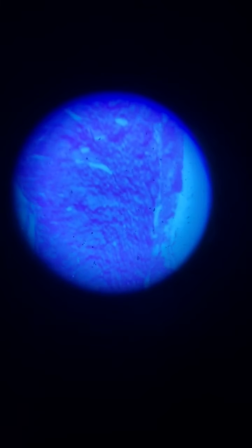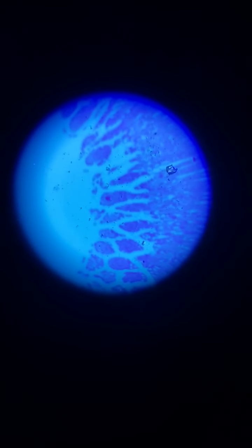It's the thin cross cut of the small intestine. You see how it looks like they have these deep valleys at the end, like in the middle. As we move this around, you're going to see there's like a big space in the middle, and that's your small intestines. That is where all your food and liquids are going through.